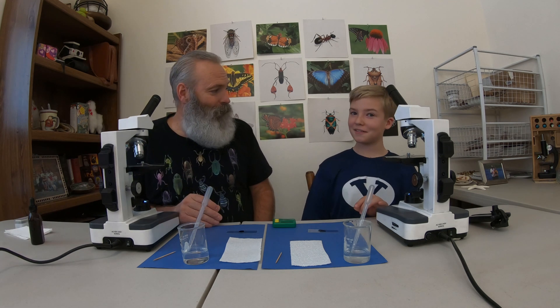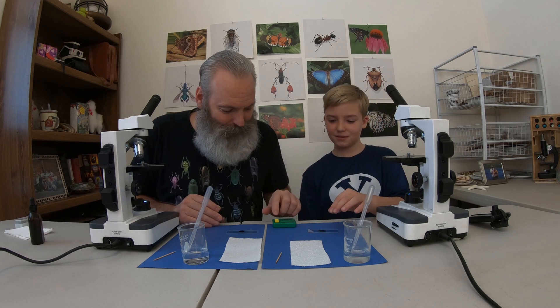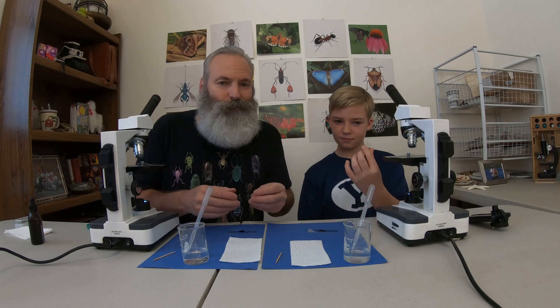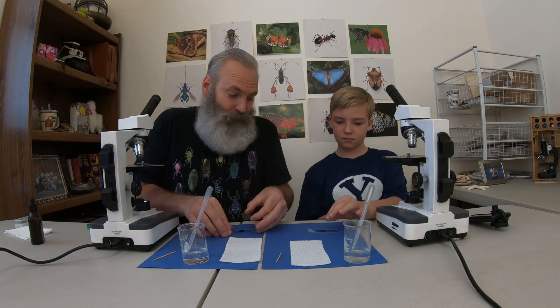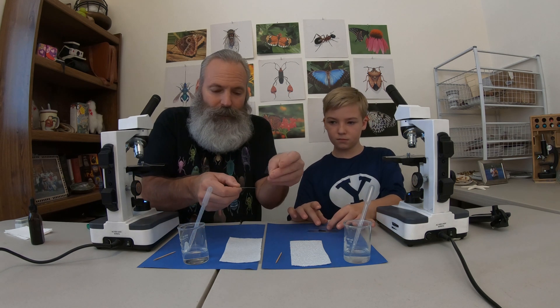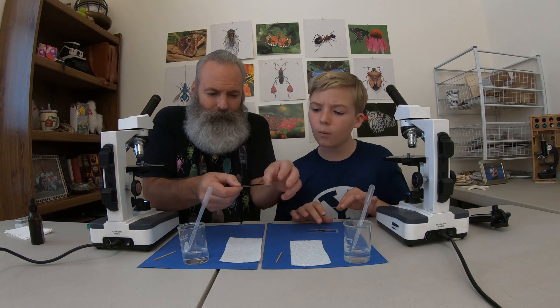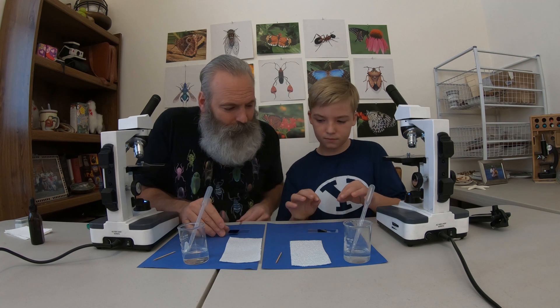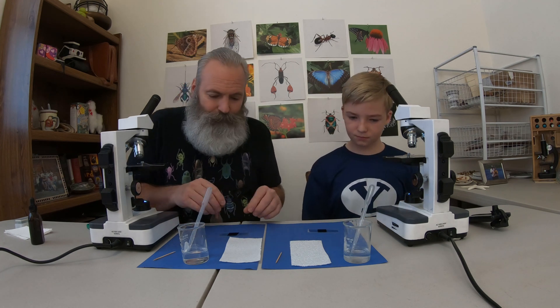Hey, we're at a minute. Okay, let's stop this. All right, so now we're going to put our cover slip on. We could have put our cover slip on right after we put the stain on, but that's okay. All right, let's go put our slide up here — looks very nice.